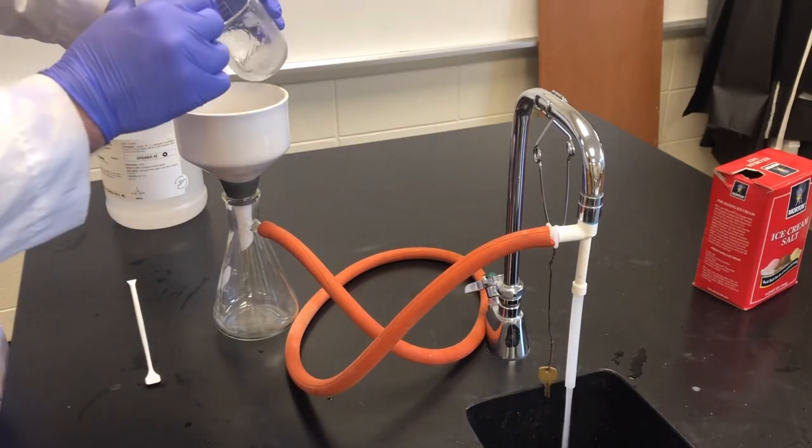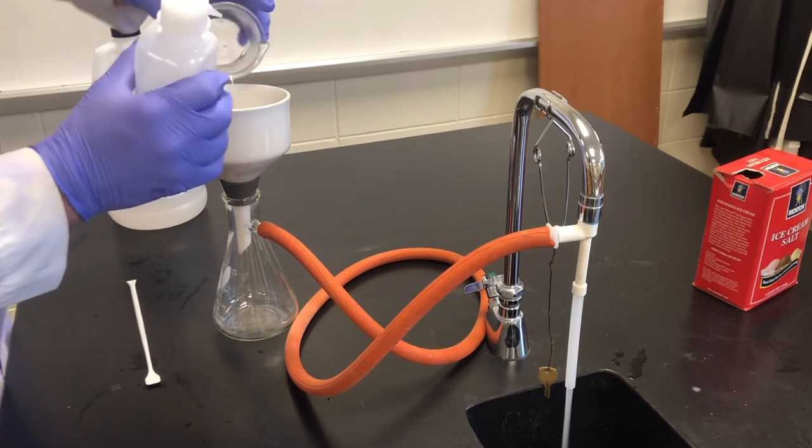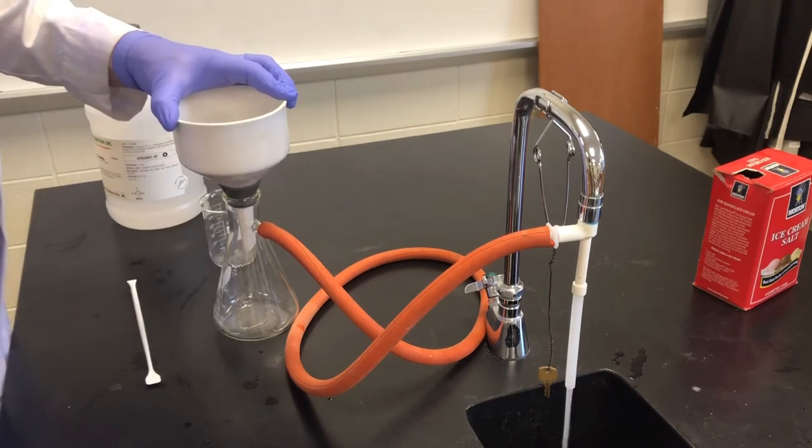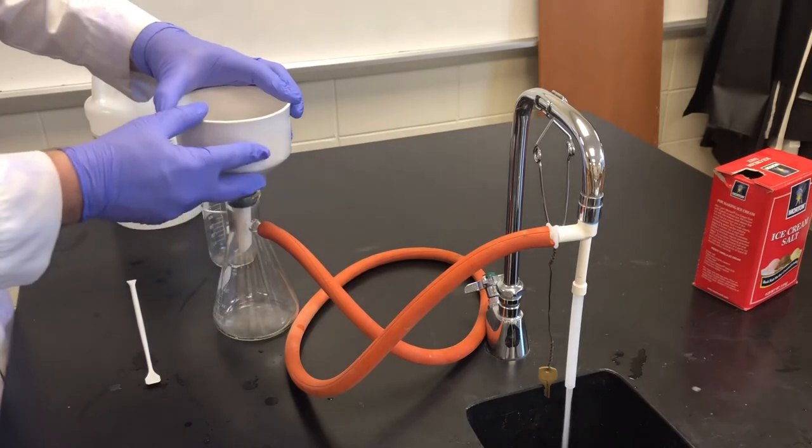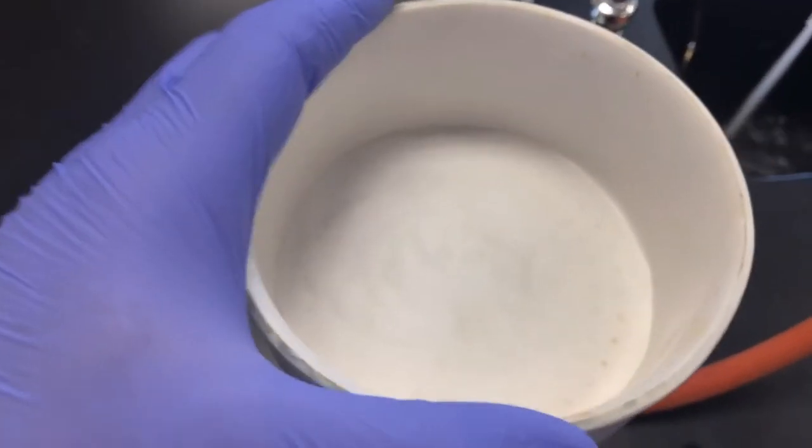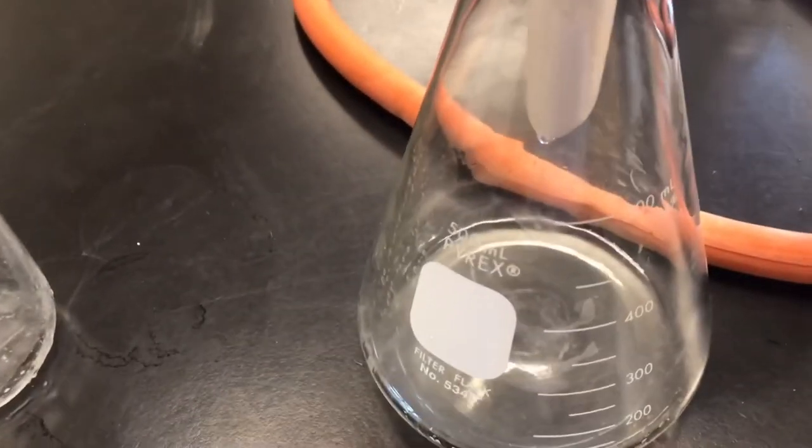Using the ethanol, we're going to try to get out of the water. Sometimes you can hear the difference in the water pressure. We're trying to create a vacuum here. I don't know if you can tell from the light, this is pulling air through this mixture. It pulls air through those little tiny holes as it pulls it into here.